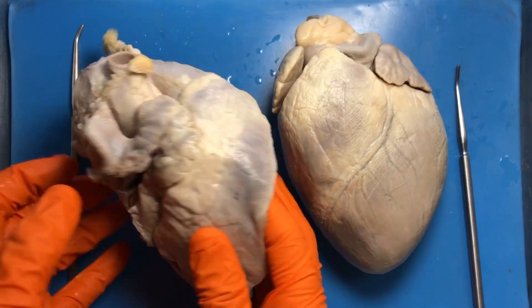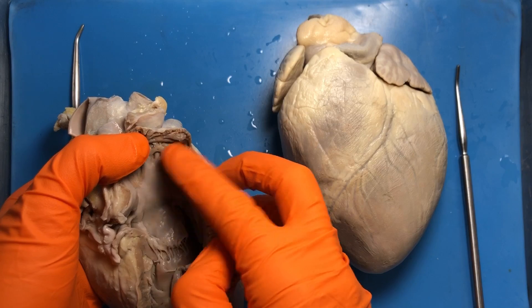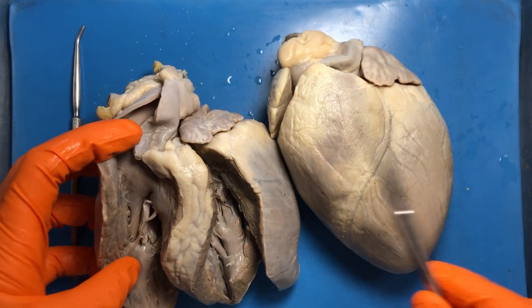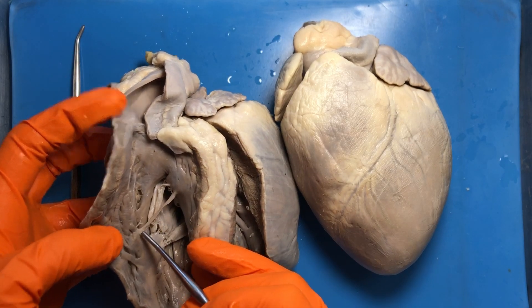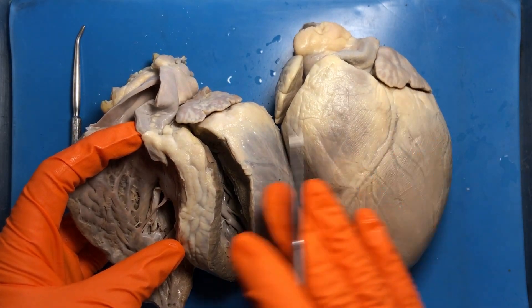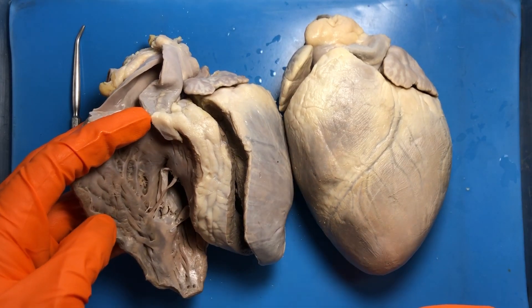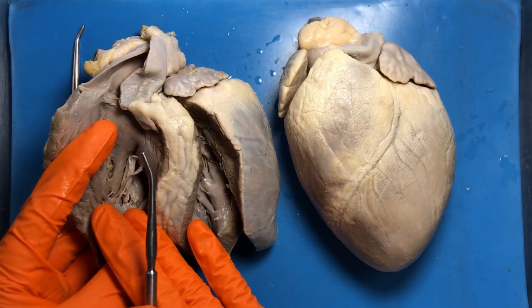To better visualize the atria, flip the cut heart over to see the right atrium and left atrium. Something interesting is that the right ventricle has a structure called the moderator band, which serves as a conduction pathway — it's part of the conduction system, carrying signals from the interventricular septum to the right ventricular wall. The left ventricle does not have a moderator band, so that's another way to tell left from right.